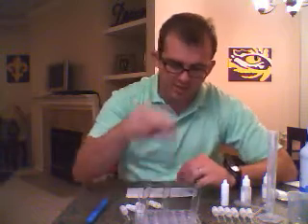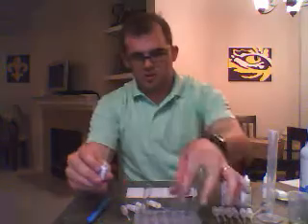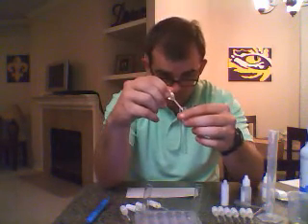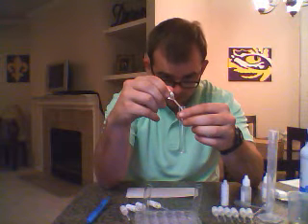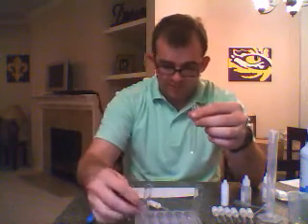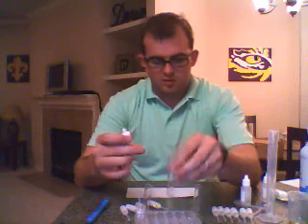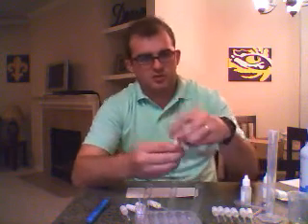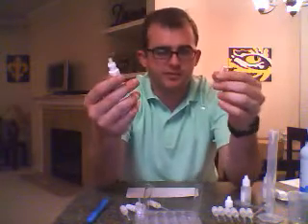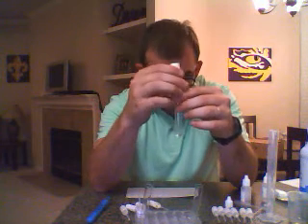Alright, so our test tube number 2, we're going to use bromide once again. So we're going to put 8 drops in there. 1, 2, 3, 4, 5, 6, 7, and 8. And now we are going to use silver nitrate. I'm going to put 3 drops of silver nitrate in there. And again, we're going to observe any different reactions or color change, or if it forms any precipitate or anything.